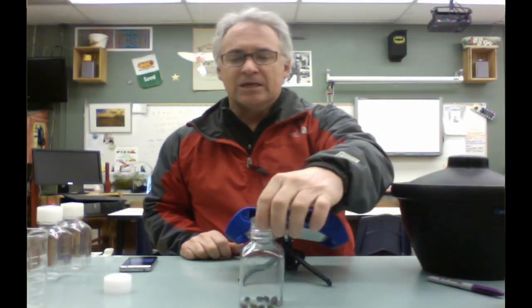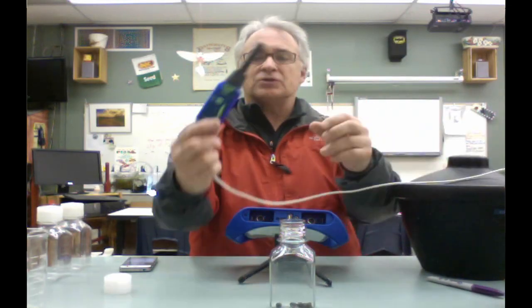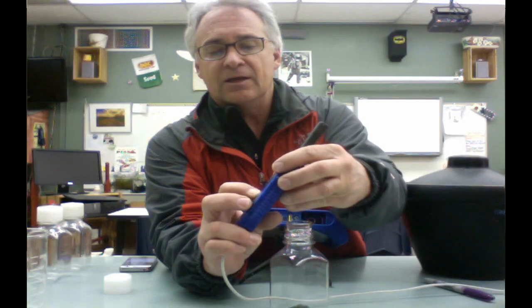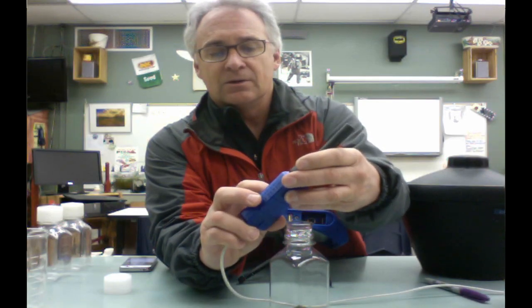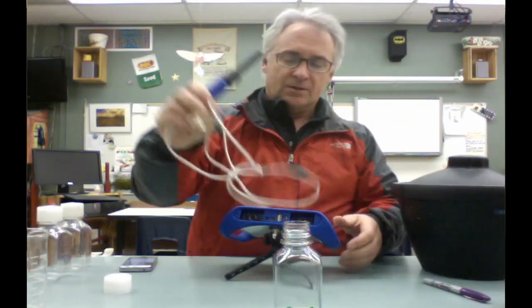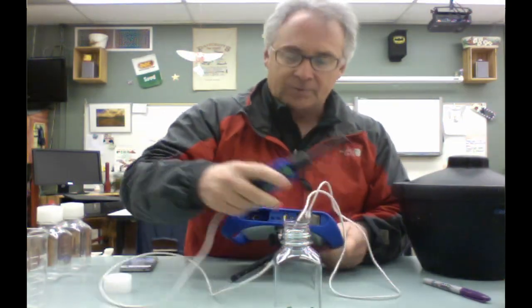Now what we're going to do is, on the first run, we're going to split the class in half. Half of you are going to put in a CO2 meter. The other half of you are going to be putting in a sensor that measures oxygen. So this is what the CO2 sensor looks like. You're going to press this calibration button until it starts to, there we go, blink. Well, first of all, plug this in right to our data logger. Then we're going to calibrate it.